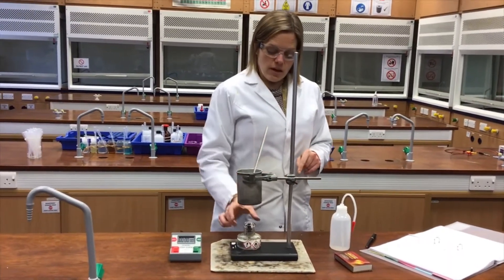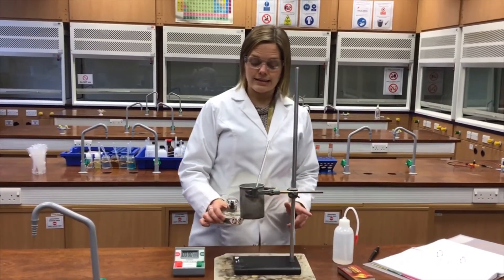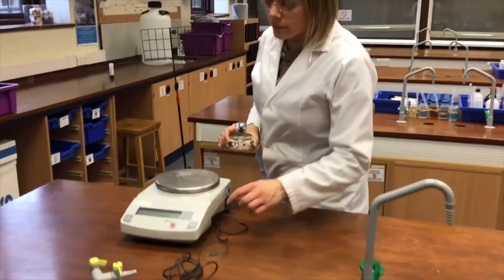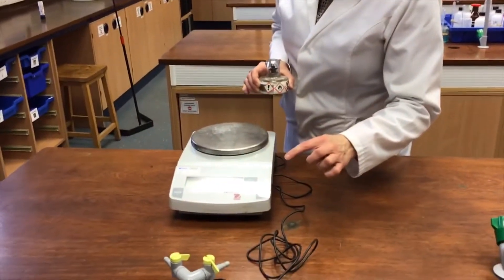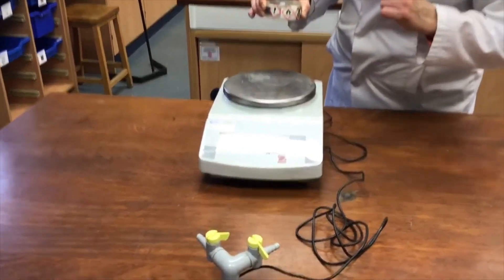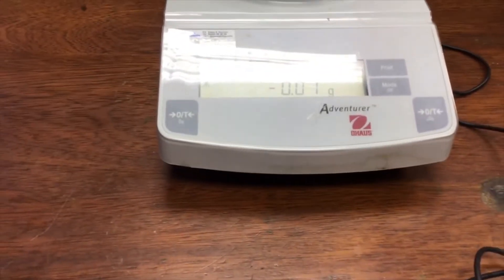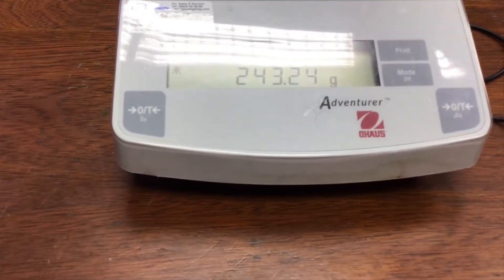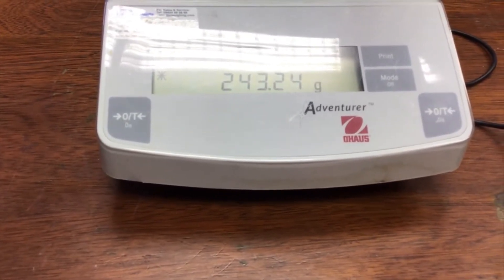The other thing I'd like to measure is the mass of the spirit burner and its lid. Coming over to the balance, I'll tare it, then place the spirit burner and its lid on top to record the start mass.